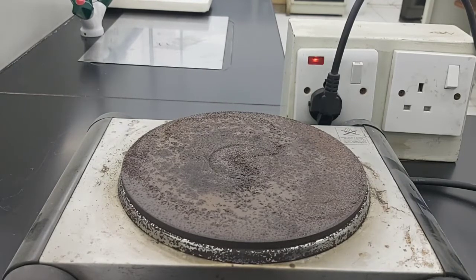So we have the materials: the cups, water. So the cups, we are going to use beakers, water, salt, spoon, and we have fine sand, some paper towels, iron filings, magnet, gravel, sieve, and coffee filters. Okay, so we're going straight up to the first one.